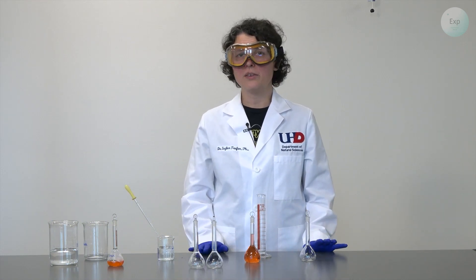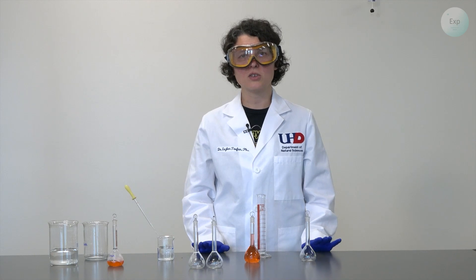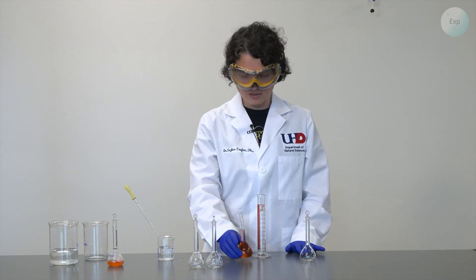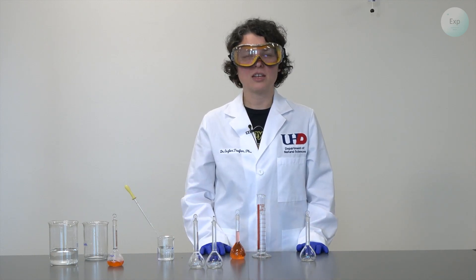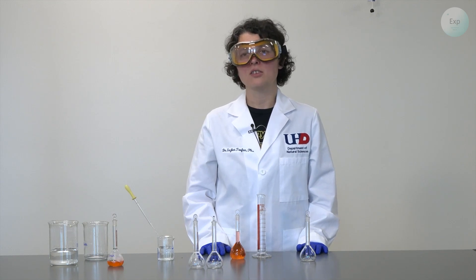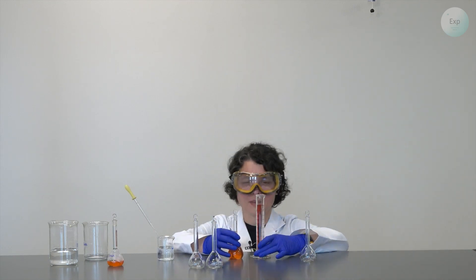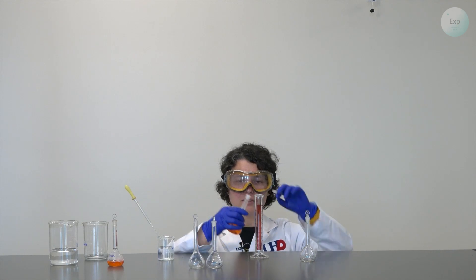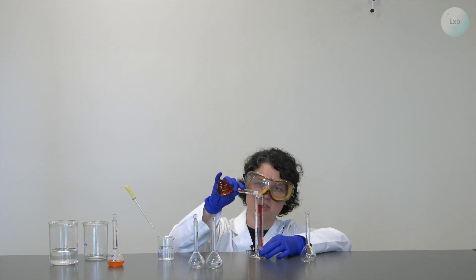Drying ensures that all the volume that you're measuring is associated with your solution and there is no trace of water that would add to your volume. Again, we measure 35 milliliters of our solution.